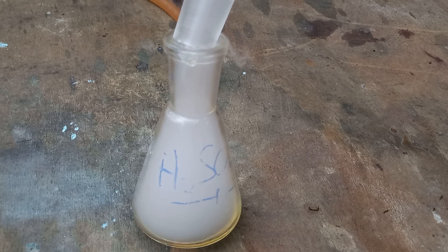The compound today we're going to make is a copper complex of copper iodide and pyridine — a pyridine-copper iodide complex. Why am I making this very random complex? It's because it fluoresces bright yellow in UV light. I thought it was kind of interesting — a fluorescent copper compound.